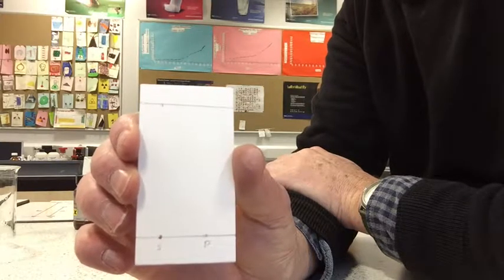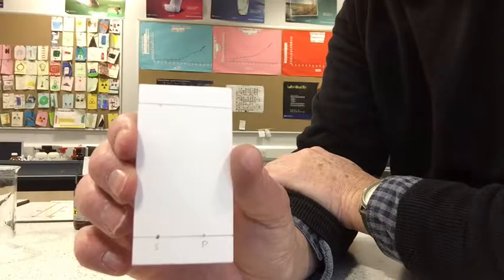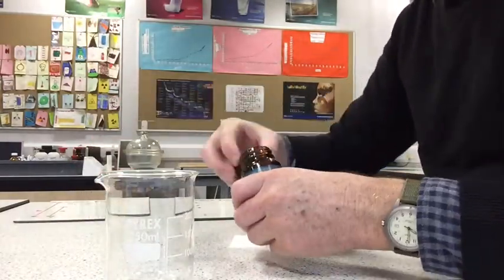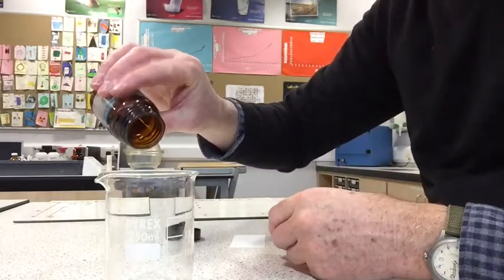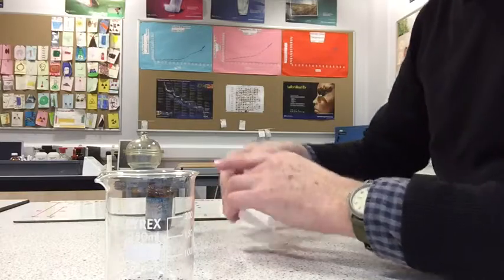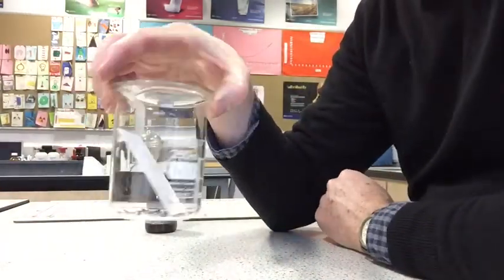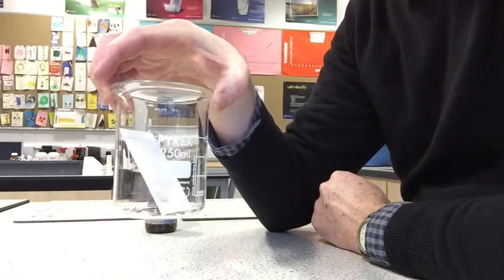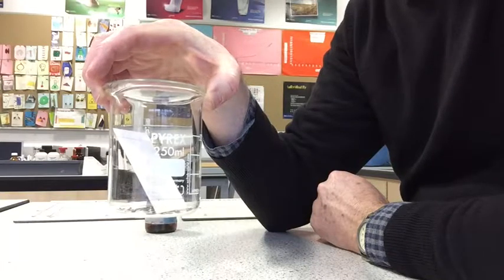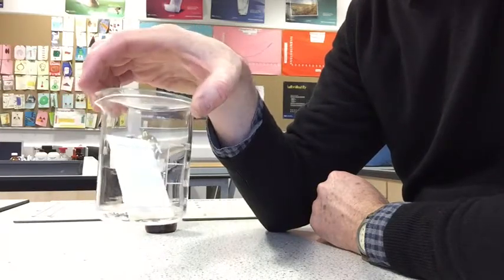This is probably the hardest part of the experiment, and it's not one that's always been successful, but we'll give it a go. In your handbook there are actually two ways suggested for developing the chromatogram. The first way involves developing it with iodine, so we'll try that one first. We get a 250 ml beaker and add a few crystals of iodine to it. We then place our chromatogram in it and just put our watch glass over it. The idea is that the iodine is quite a volatile substance and will easily turn to gas, and the iodine will interact with the benzoic acid and produce a brown patch on the TLC plate where the benzoic acid is.